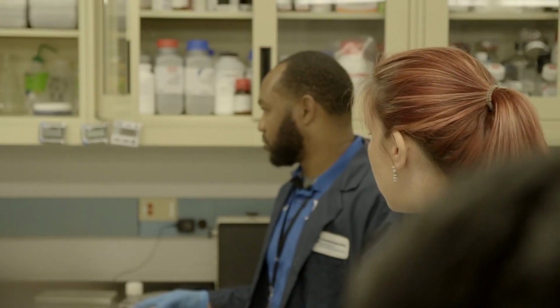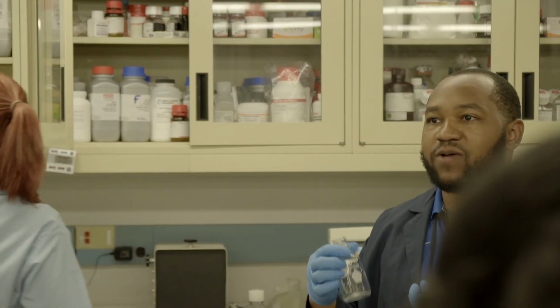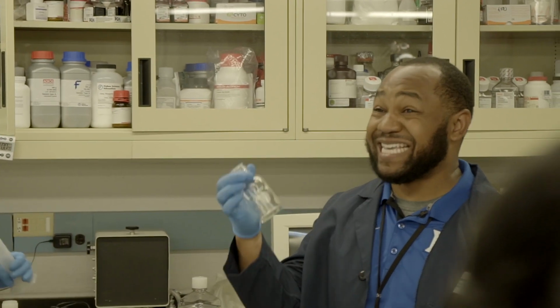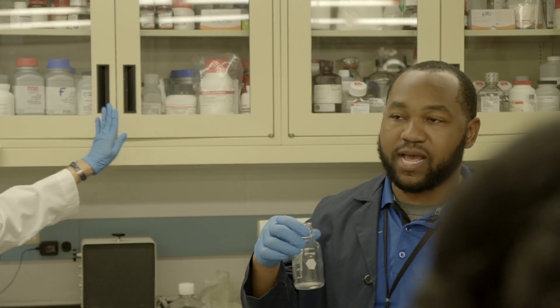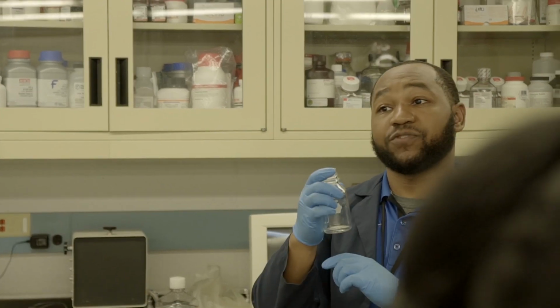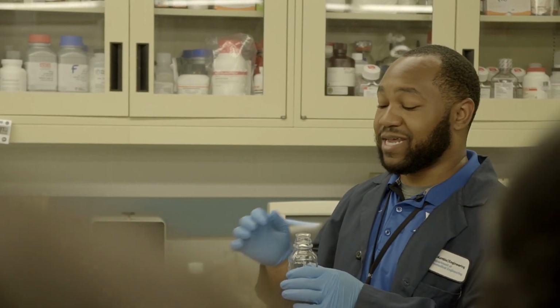And this is going to be a powder. Are we going to stir it up, Mike, like we did with PBS? No, we're not. So the first thing we're going to do is measure out 50 mils of the 1x TAE that Rachel just made, and because we're trying to form a gel, and because of how agarose polymerizes, we actually have to heat this. So we're going to put it in the microwave for about 45 seconds, and then add more time as needed until it completely dissolves. At that point it is going to be very hot, so Christy and I are going to be very careful and only hold at the top of the lid with a paper towel, so it's more insulated, and then we're going to slowly pour it into the cast, okay?